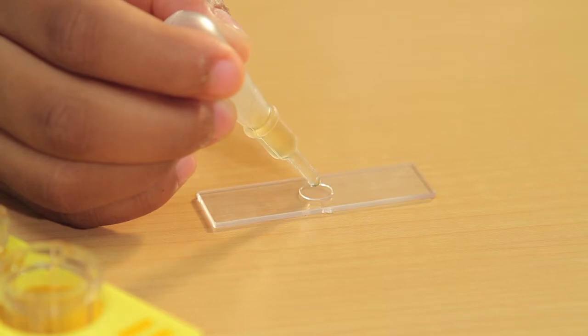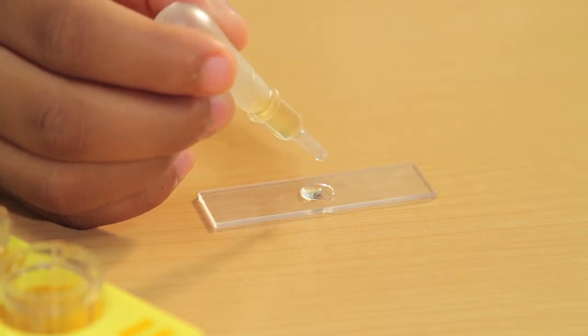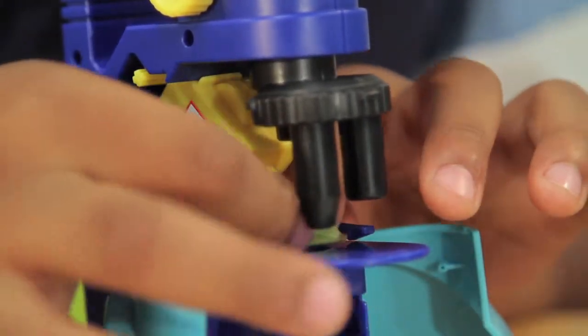Use the dropper and the concave slide to observe liquid. Place thick objects directly on the stage.